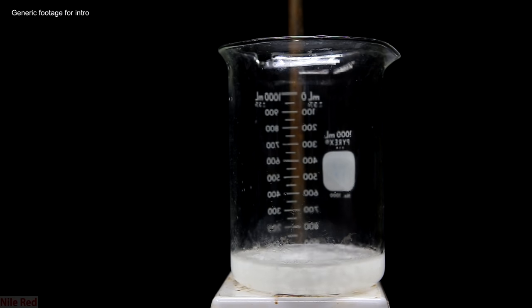This technique takes some patience, and I went a little bit too fast with my lidocaine, and it kind of crashed out instead of slowly precipitating, but I was still able to get pretty nice crystals. In the case of my lidocaine, I did this at room temperature, but there are some cases where it can be done at boiling temperatures.